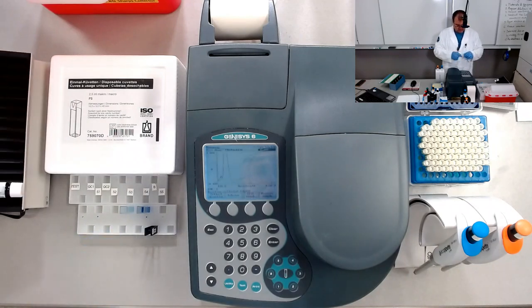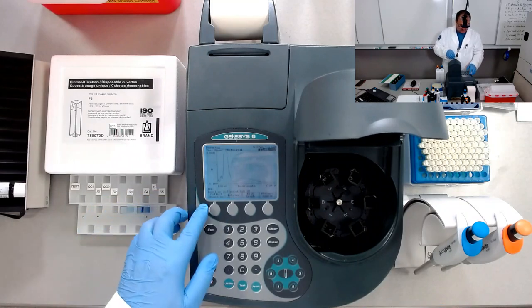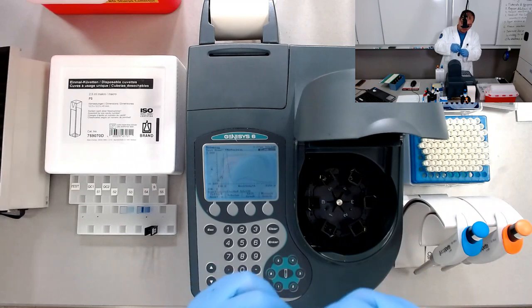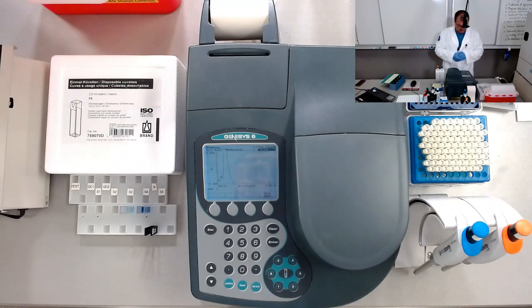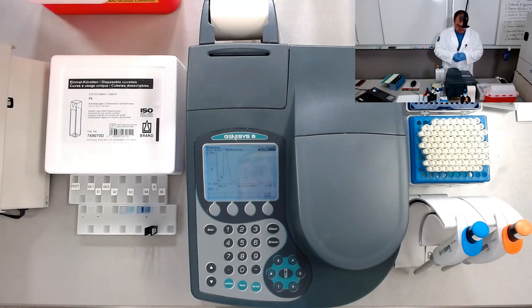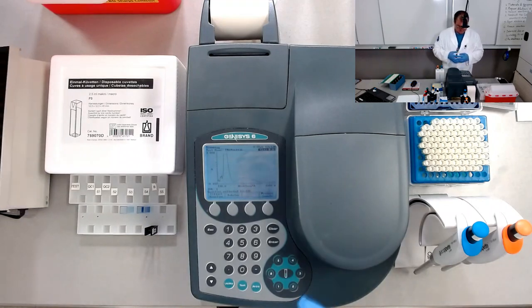So this is the curve from the previous absorbance spectrum test. Let's collect the baseline blank in the blank position on the carousel in here. Let's wipe the cuvette a little bit. So, collect baseline. It will take some time to collect the baseline, meaning that it will set up the I0. Remember, I0 is the incident light intensity, and this one will be collected pretty soon. So we collected the baseline.